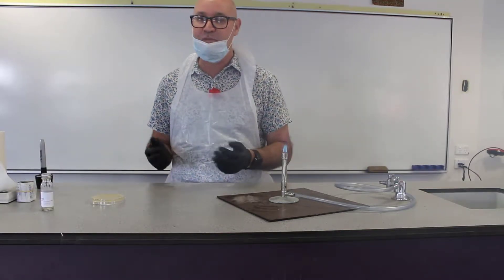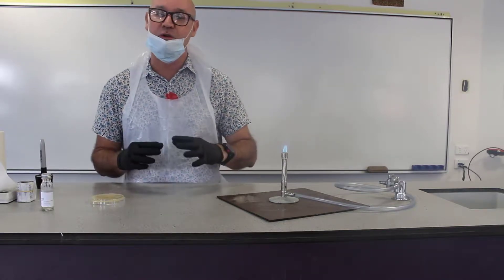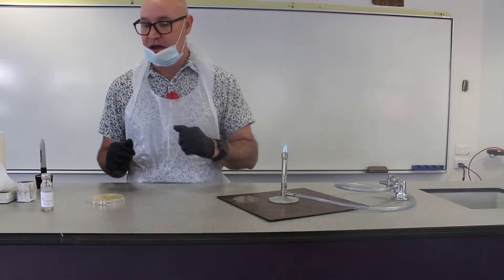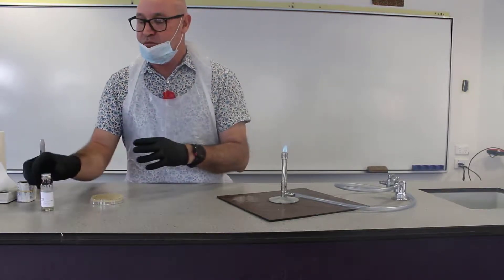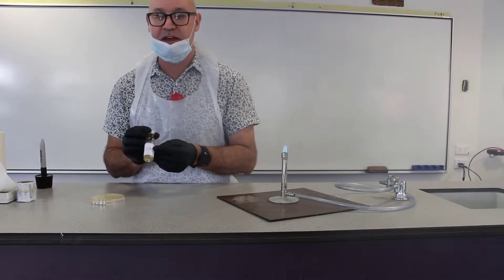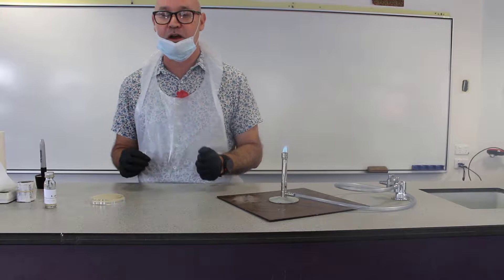Importantly, aseptic means without sepsis, in other words without infection, without microbes. So we want to try and purely grow this bacteria E. coli and not have it contaminated with any other microbes.